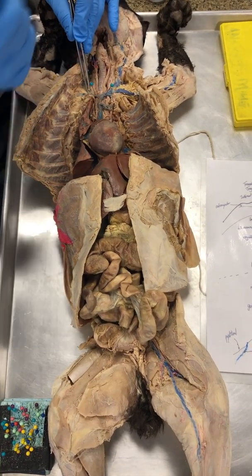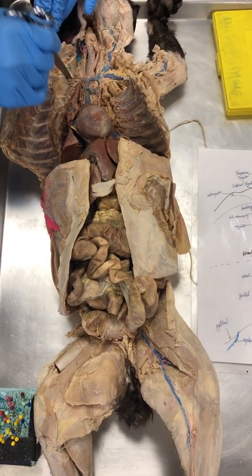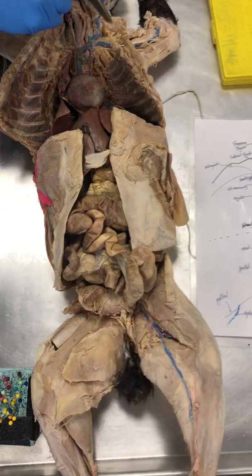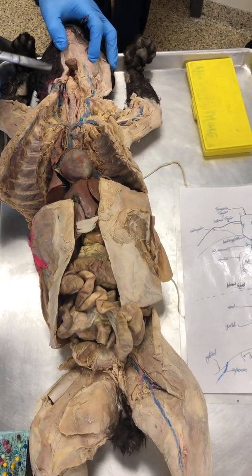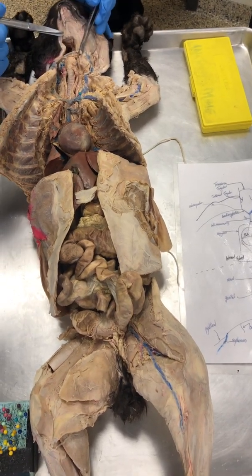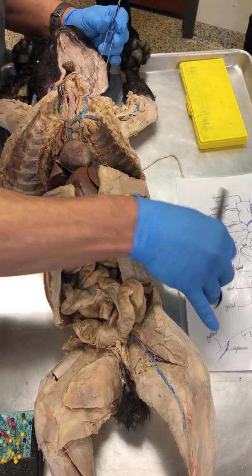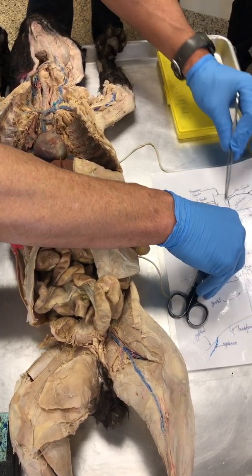All right, so I'm going to take this out here now, because I'm going to work on the left-hand side. So everything that we see here is in the right arm and the left arm. So here we've cleaned out the left arm right there. All right, and notice nice big cat, so things look very nicely here for us. All right, so what do we see now, folks? So now that is the point of reference right there. So please look. So what letter do I see there again?